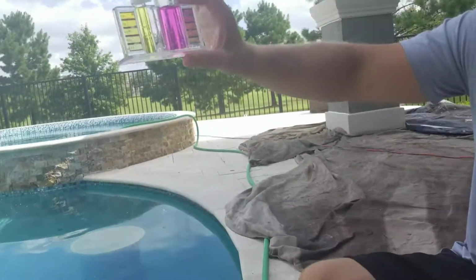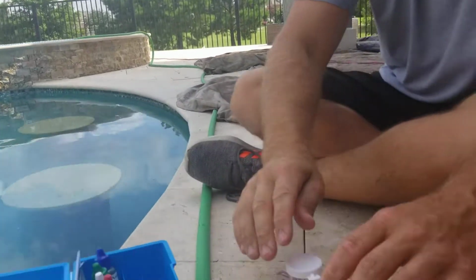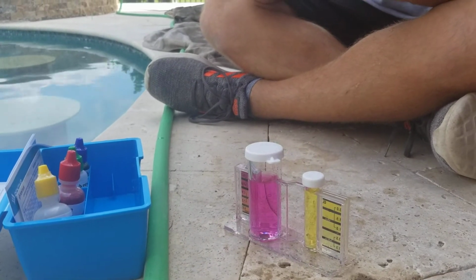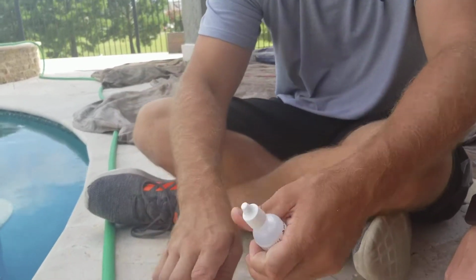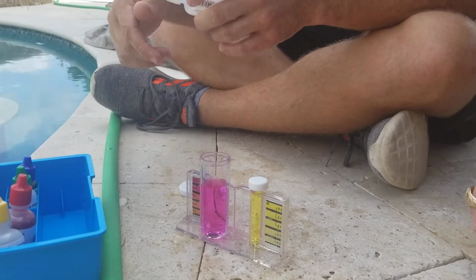Our pH is high. It always is. Yeah. Especially all the plaster dust and stuff. So, based on that, now we'll have to do the acid demand test. We will add 1 drop of this at a time. Shake it up until this changes to our ideal range, which is 7.2 to 7.6. So more of an orange. Okay. And that'll tell you how much acid you've got to throw in. That'll tell me, yep, how much acid we need to put in the pool.